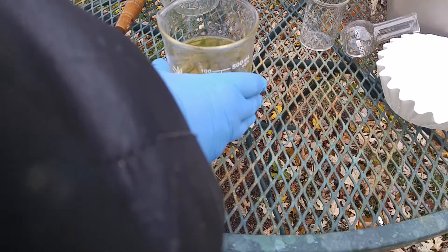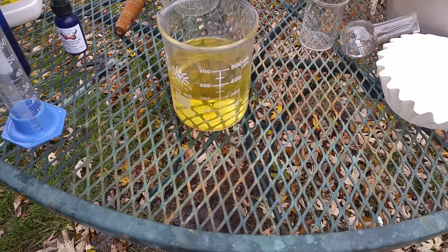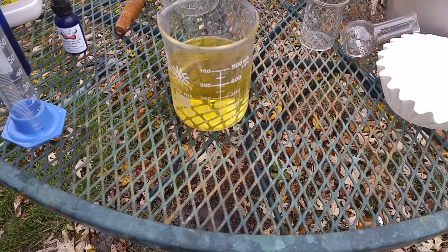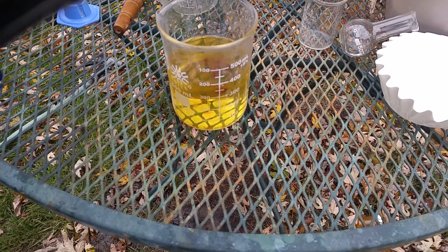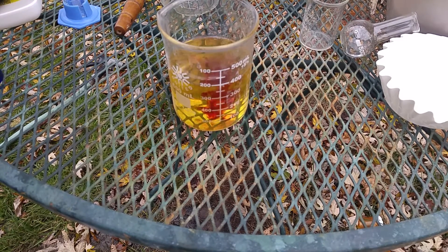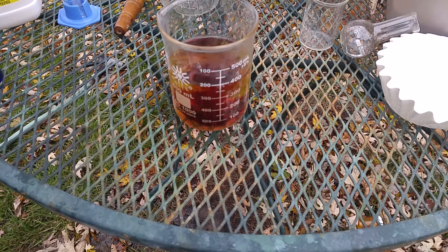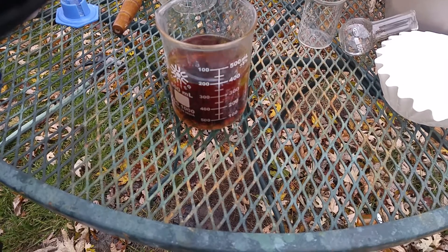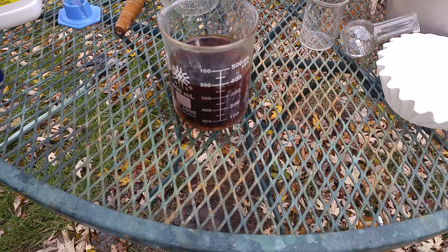Here we go. Heat it up slightly. Oh, by the way, if you are in Celsius land, it is currently about two degrees — so I'm doing this in the worst conditions as you can see. The iodine begins to precipitate right here, as it's being oxidized.